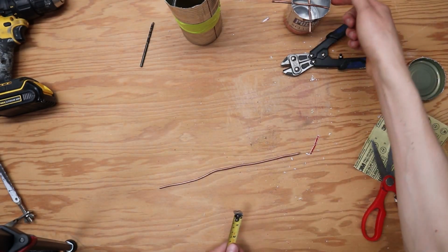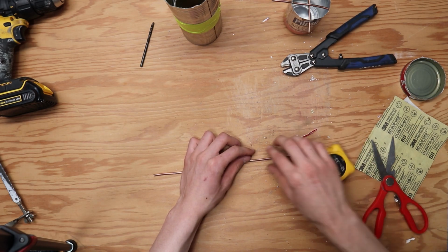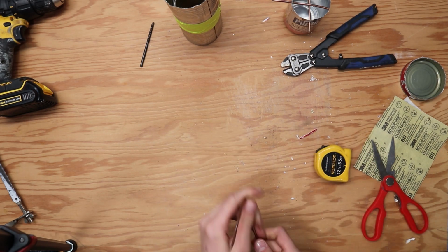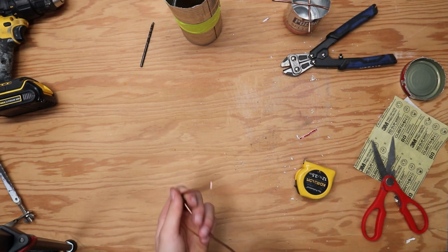Using the remaining portion of your stiff wire, measure 8 centimeters. Then bend it at a 90-degree angle at that 8 centimeter mark. Then you're going to bend the wire around so that your wire will stick straight up.